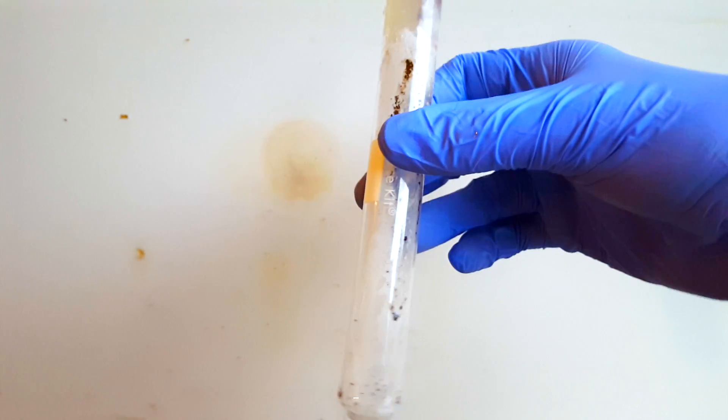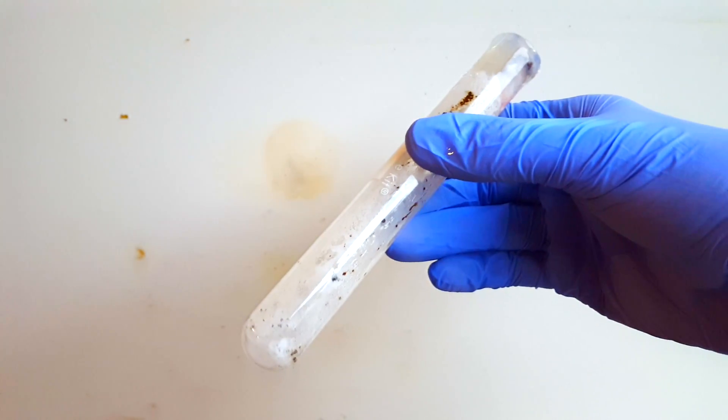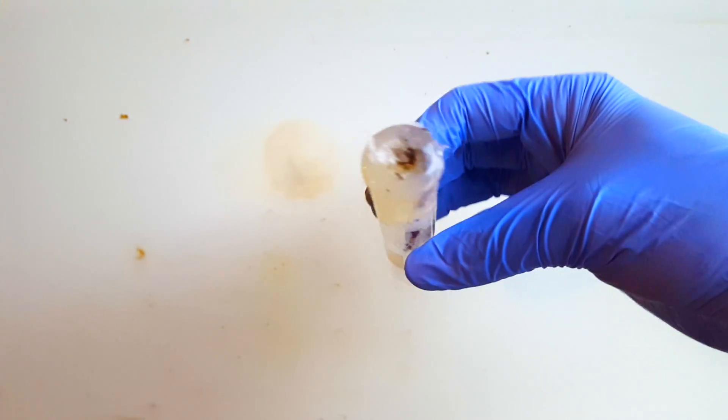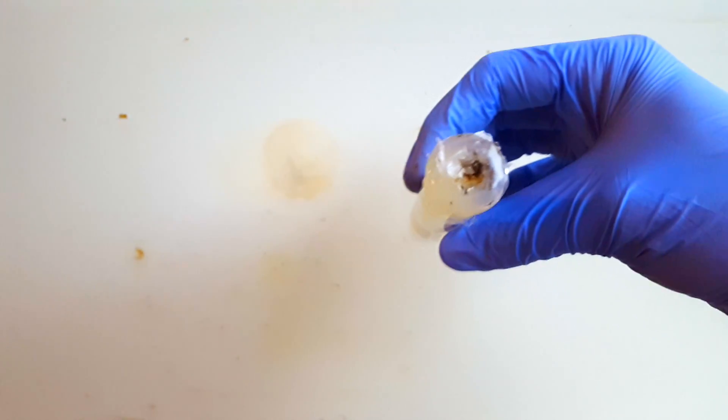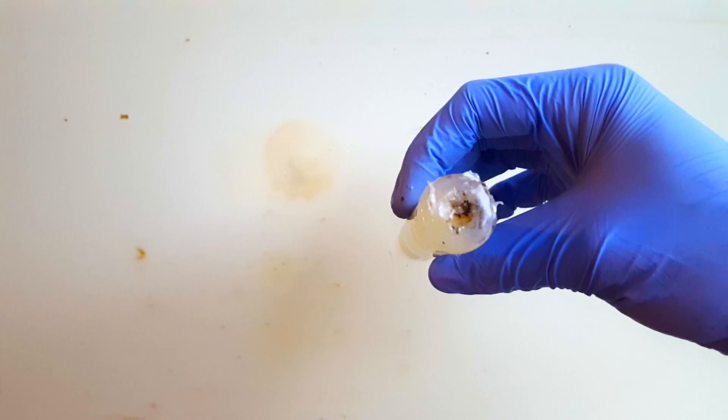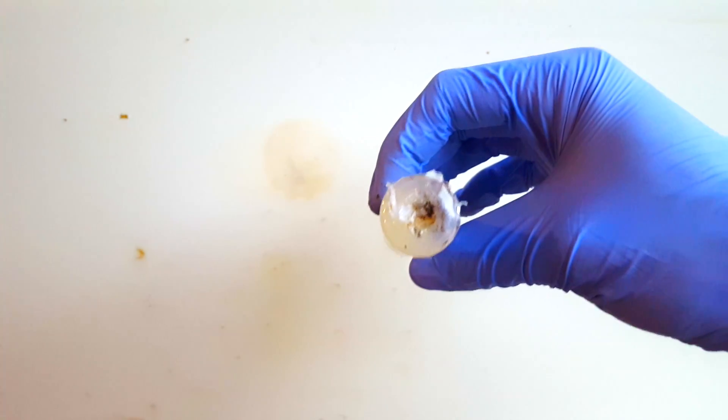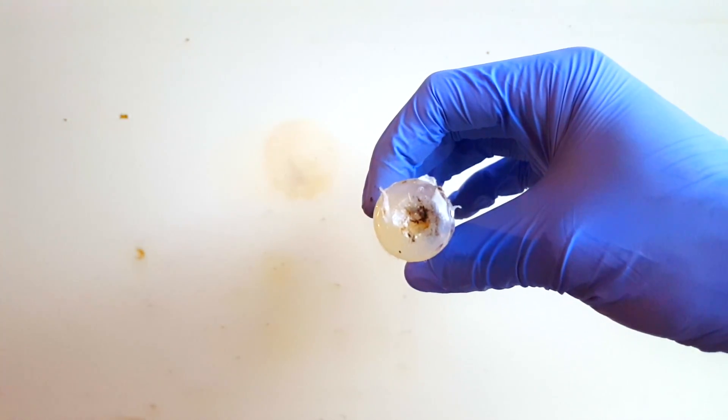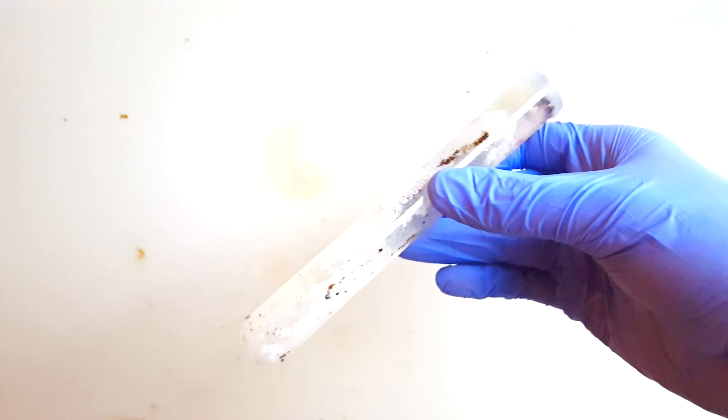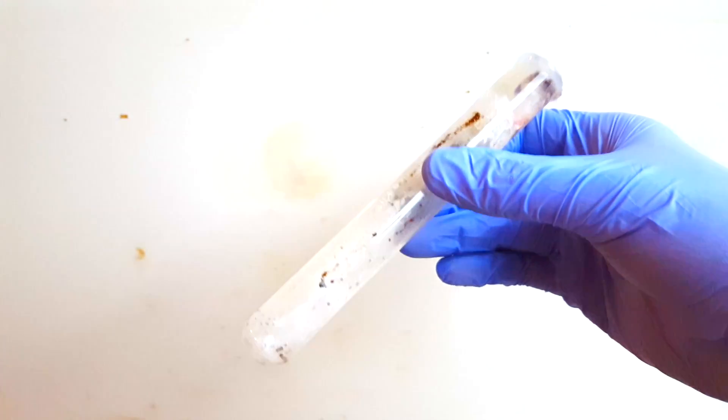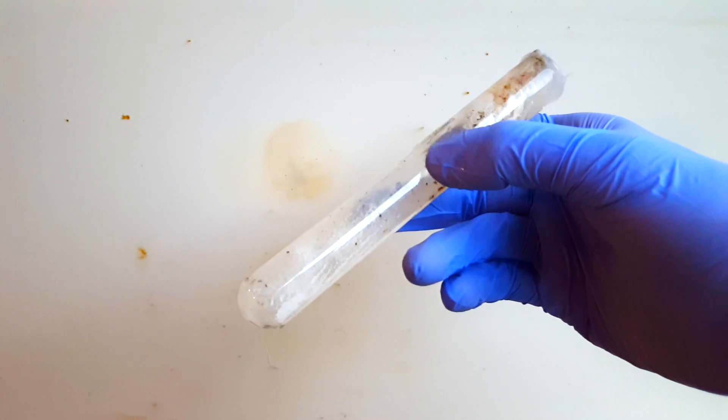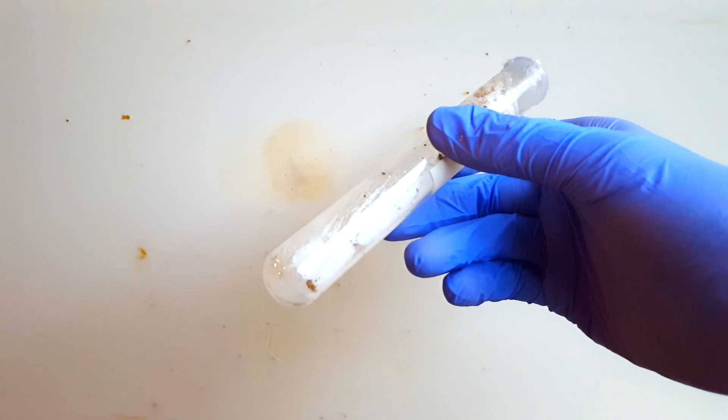Overall, I was very impressed with how well this test tube rocket worked out, especially considering the glass survived unscathed. I would definitely like to revisit this idea in the future, maybe getting it to stand up or having a much wider shot.